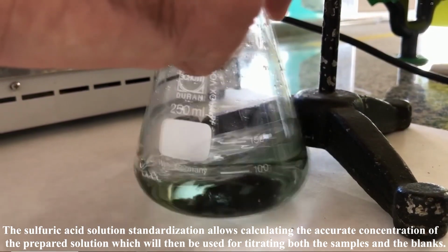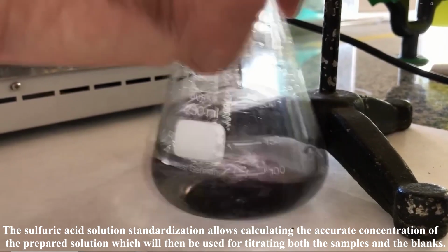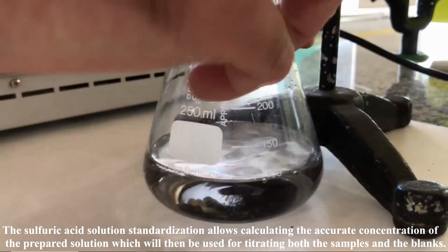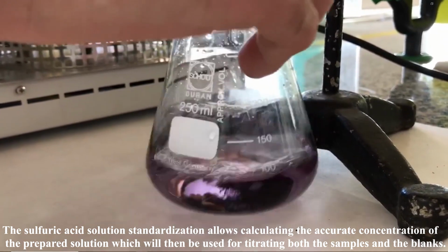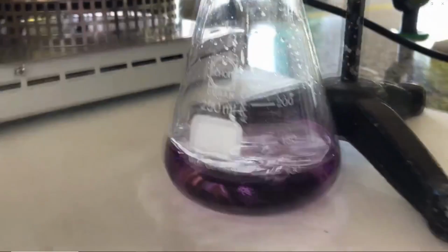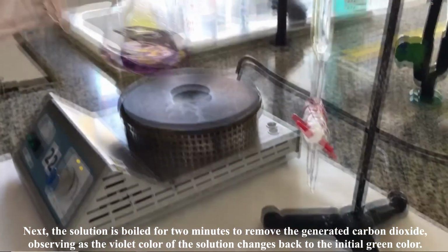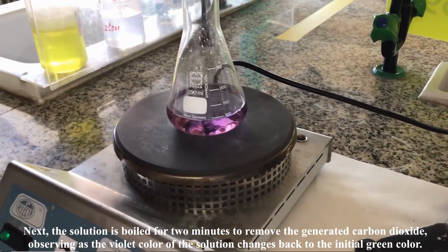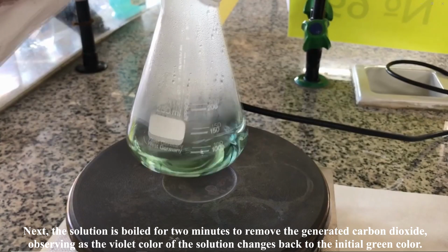The sulfuric acid solution standardization process allows calculating the accurate concentration of the prepared solution, which will then be used for titrating both the samples and the blanks. Next, the solution is boiled for 2 minutes to remove the generated carbon dioxide, observing as the violet color of the solution changes back to the initial green color.